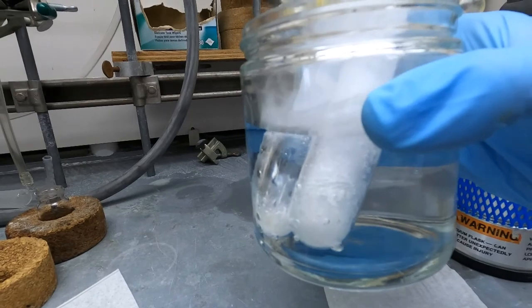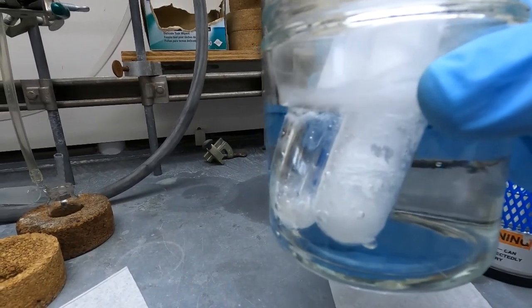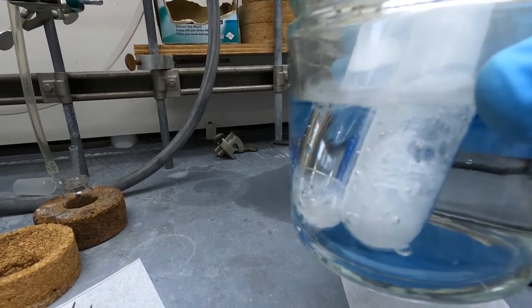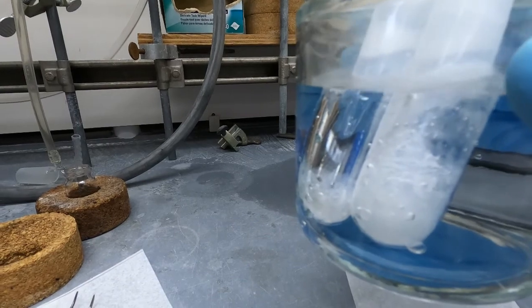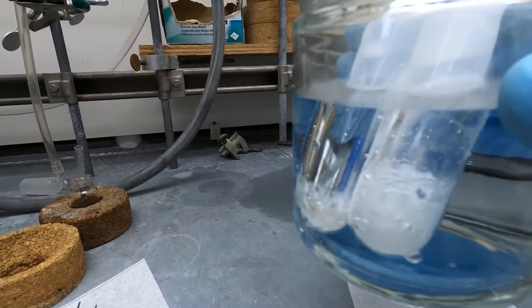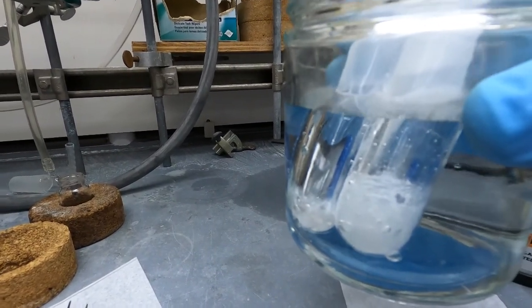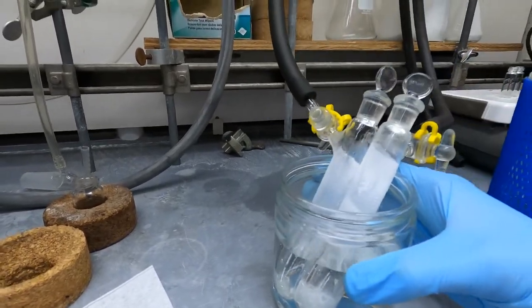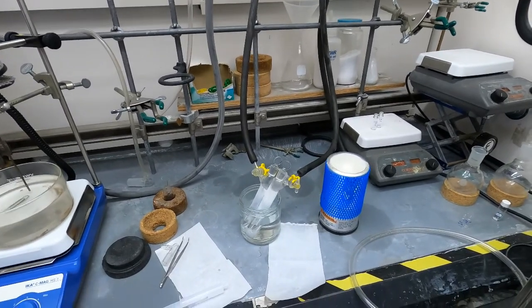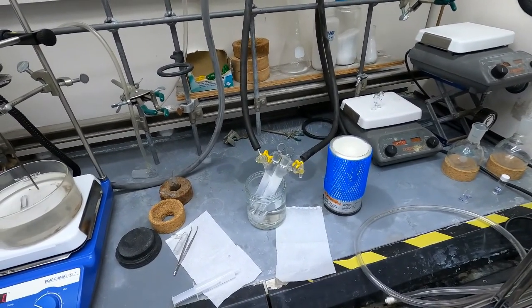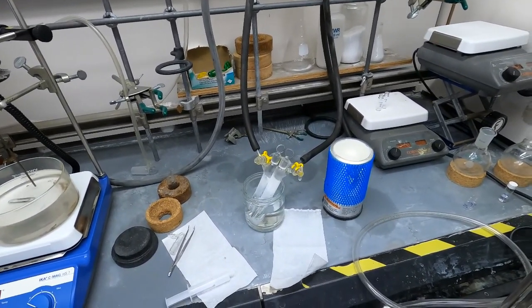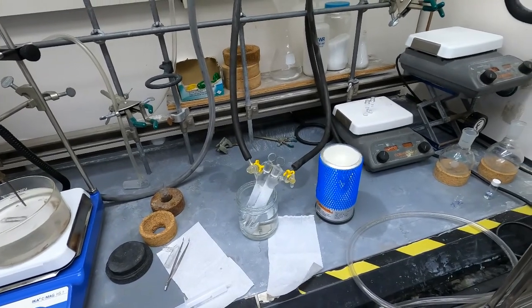As you can see, as they're thawing there's a lot of bubbling coming up from the solution and that's all the dissolved gas that was in the toluene. There's a lot of dissolved gas and that's going back up into the headspace of the tube and this is why we do the freeze pump thaw three times. We just evacuated the headspace but now there's a lot more gas back in the headspace. So we'll do another two freeze pump thaws to remove all of that gas.